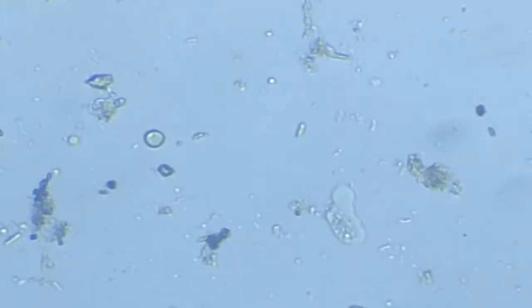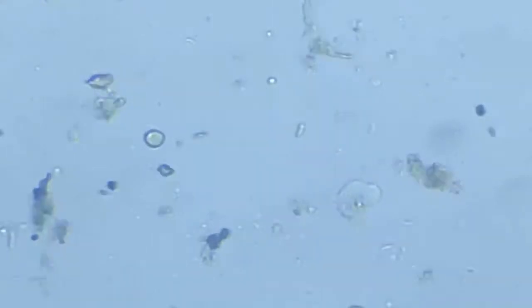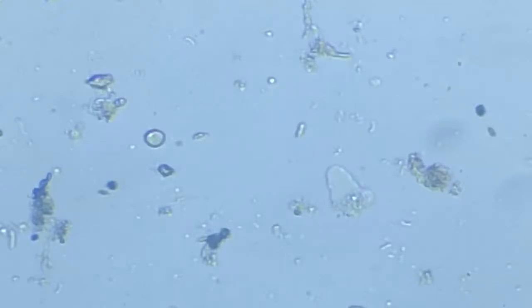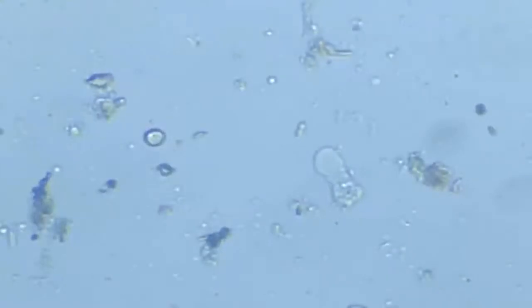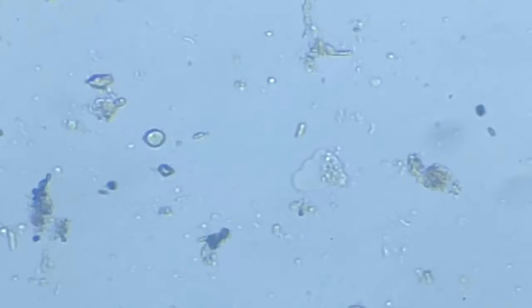And as it does so, you can see there is a small refractive difference between the sol and the remaining part of the body protoplasm. The extending protoplasm, that is the sol, is a little brighter and more shiny, while the posterior dragging part, the remaining gel part, is relatively not that shiny, but appears a little thicker and a little, so to say, gelled out.